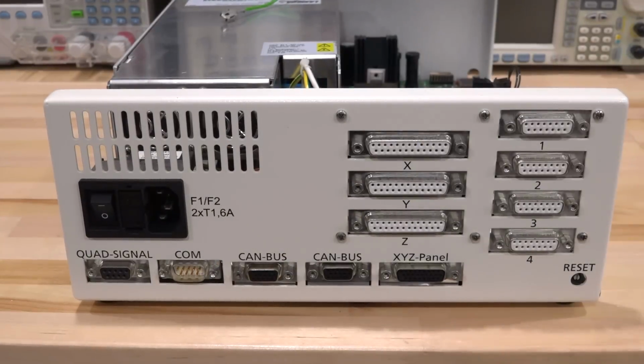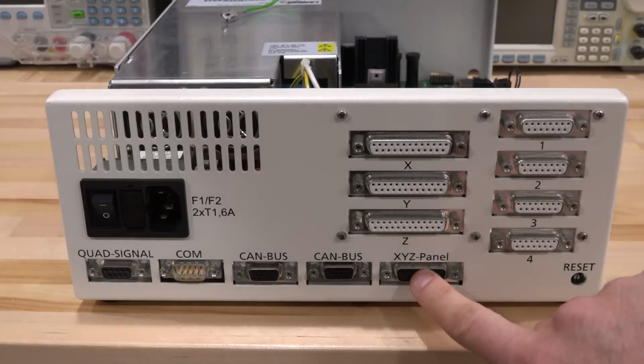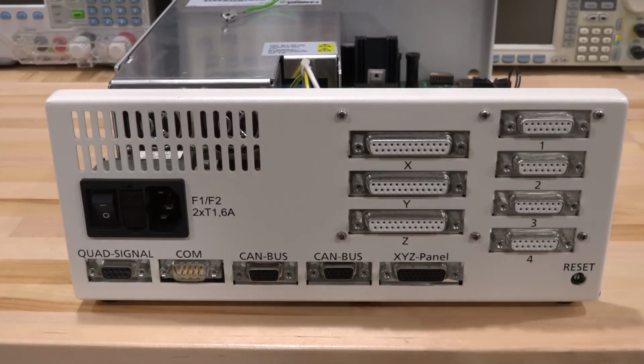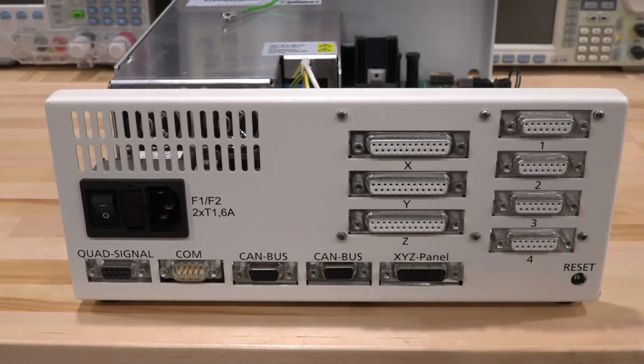So here's the back of the MCU28. As you can see, there are a lot of interfaces. It actually can control three axes of motors. In this case, I'm using X and Y because the Z is directly built into the microscope. Here's where you can control using the joystick. There's two CAN buses, which I'm using with the actual microscope body. And here's a COM port in there if you need to use that for controlling it directly. A whole bunch of other controllers here that you can have stepper motors and mirrors and so on that you can control with this. It's really built to be an all-around solution for a very complex setup. As a result, these things probably were very expensive when they were originally introduced, and they're still somewhat expensive if you look for one on eBay.